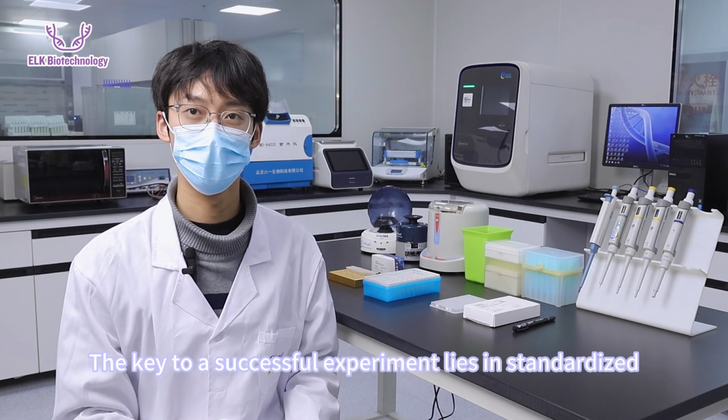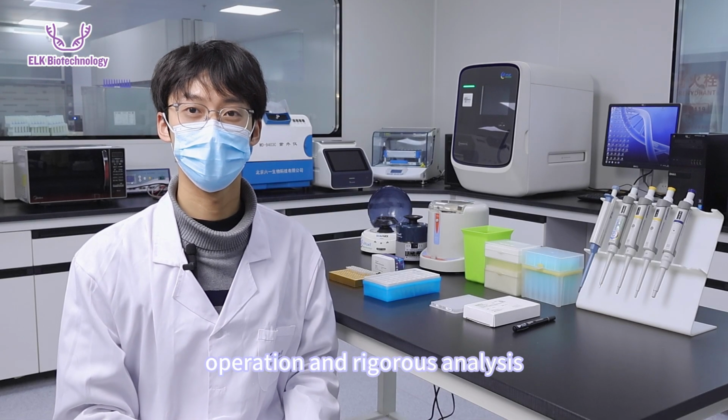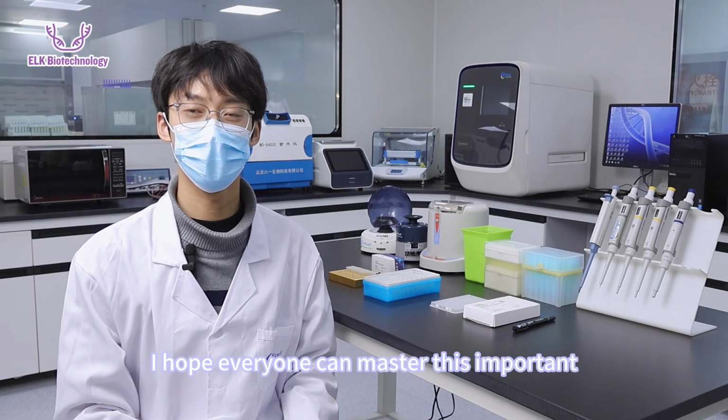The key to a successful experiment lies in standardized operation and rigorous analysis. I hope everyone can master this important molecular biology technique.